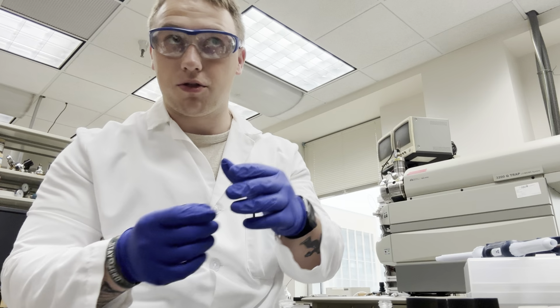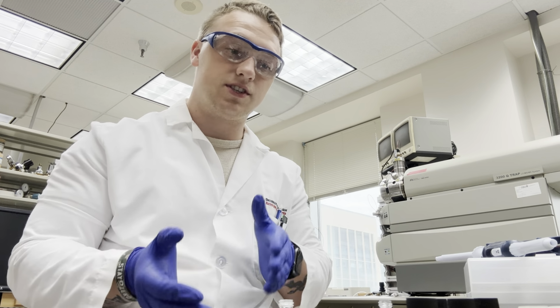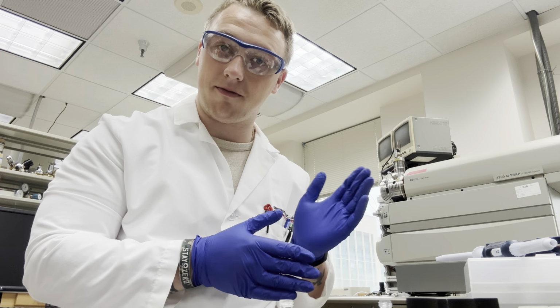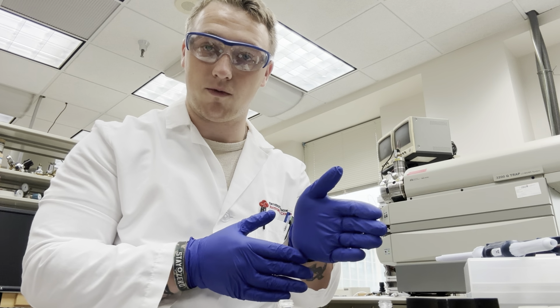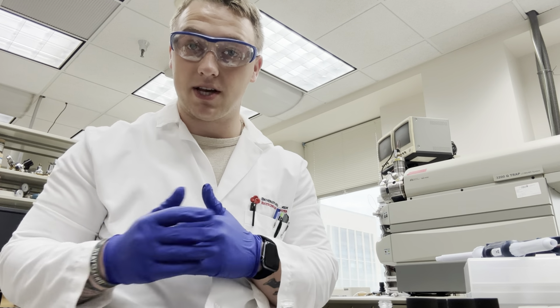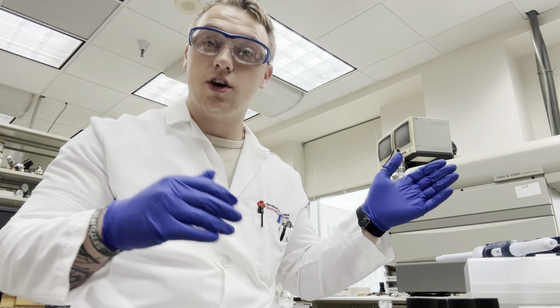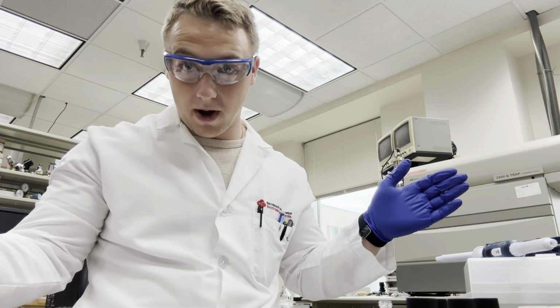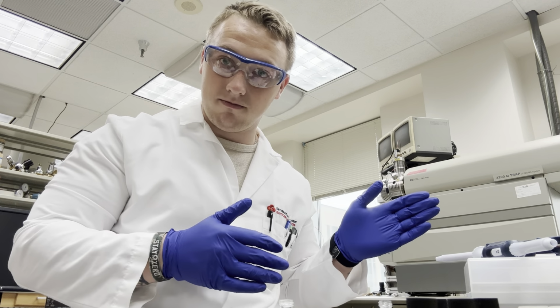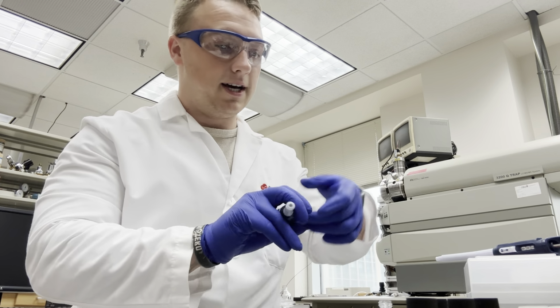So I'm going to pick 3,000 microliters. So 600 microliters are going to be the 5 milligram per milliliter solution of this Nile red we just made up, and 2,400 are going to be of the solvent DMSO. And again, that's a 600 microliters to 2,400 microliters dilution, to get it down from 5 to 1. So purely a numbers game here. So let's get that ready.